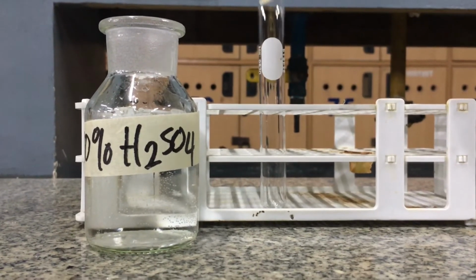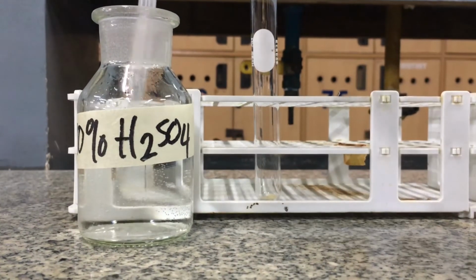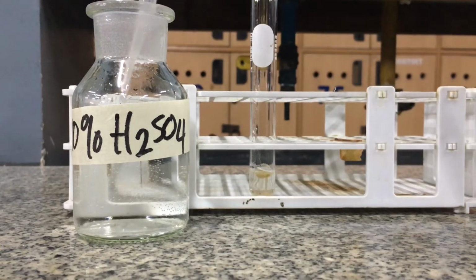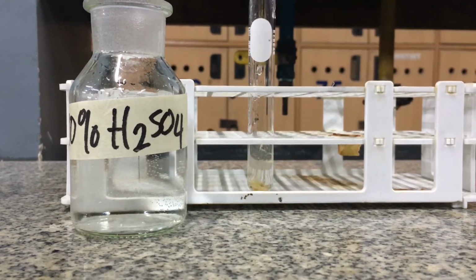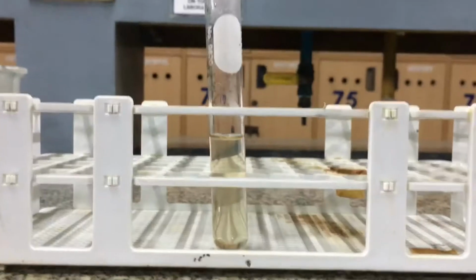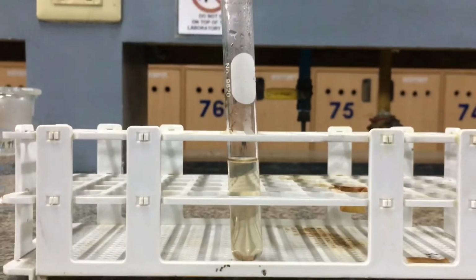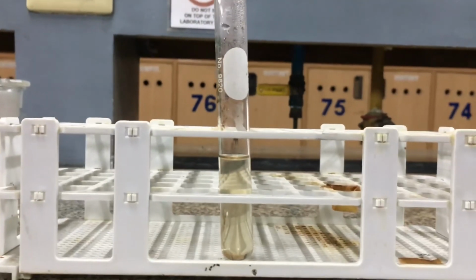Hydrolysis is conducted by placing a pinch of yeast RNA in a test tube, and then mixing it with 10 ml of 10% sulfuric acid solution. And then heat the mixture to boiling for 2 minutes. Cool the mixture after boiling. This is now known as a hydrolysate. Save it for the chemical tests of the components of nucleotides.